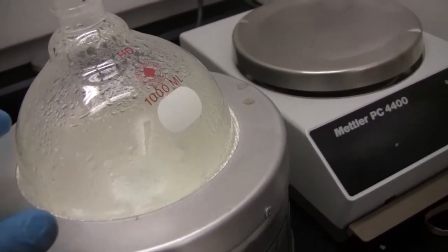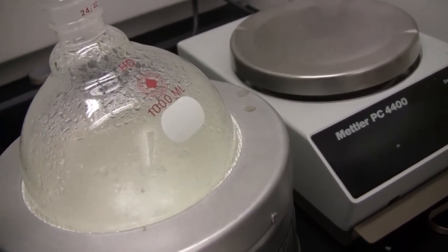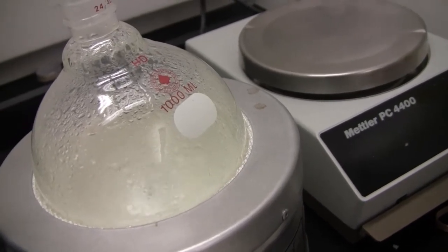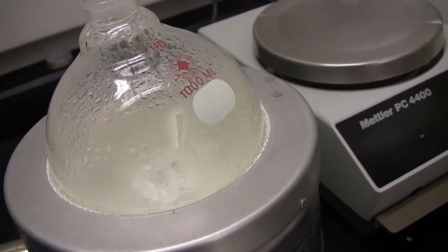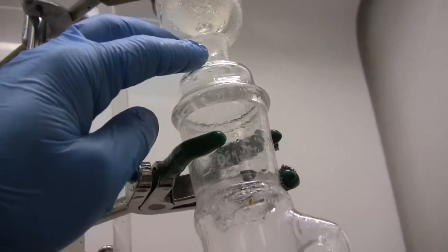So the idea would be like this. We have toluene here, toluene is boiling, we add some boiling chips so that the toluene doesn't overheat because it may explode or cause a problem, and we don't want that to happen. And then the toluene starts to evaporate. The vapor of the toluene goes around the core, and it has very high temperature, higher than the boiling temperature of water, so that the water will also evaporate. And then both of them go into the condenser, and we have a stream of running cold water inside the condenser.